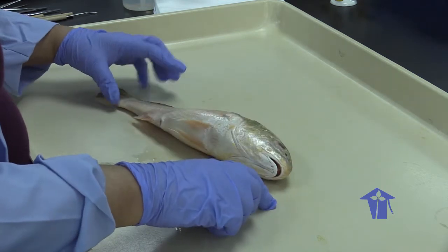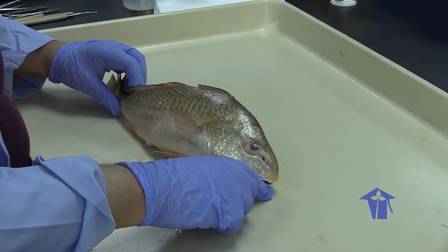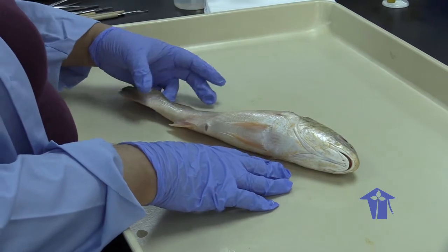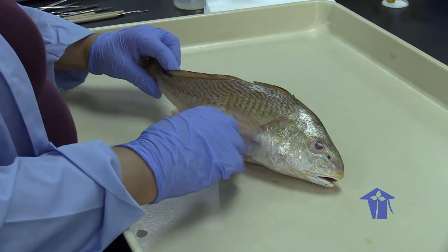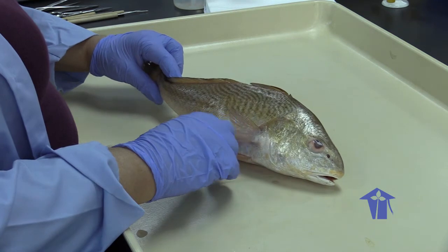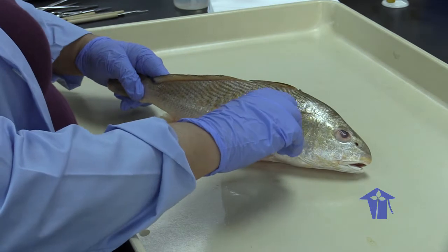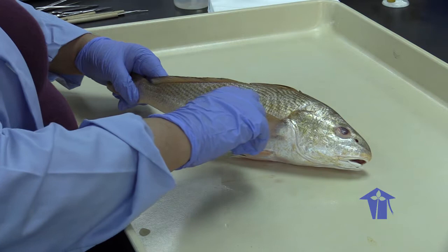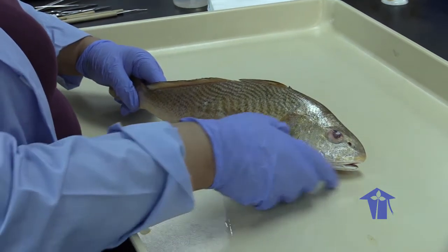Right. So as with all other organisms, the first thing you do when you're trying to dissect or look at a particular system is look at the body, the external body of the organism. Right? So I can make some deductions about feeding, and I could look at some accessory feeding structures on this fish as well. So on the fish, you see that there is this line in the scales, right? This is the lateral line. This is a sensory structure that the fish can use to evade predators and find food.